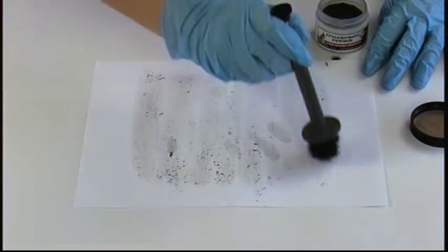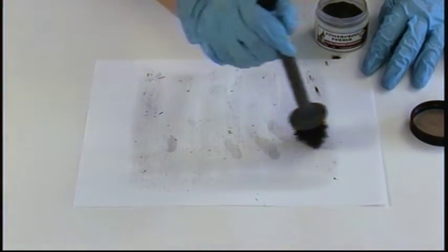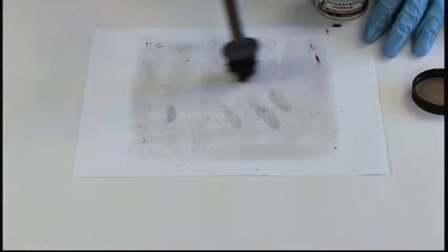When developing with magnetic powder, remember that it's more abrasive than regular black powder because of the iron in it, and it can actually wear away at the latent print you're developing. So be careful not to over-develop and wear away your print.